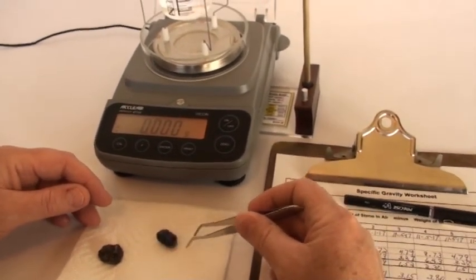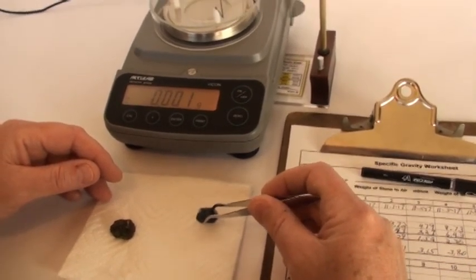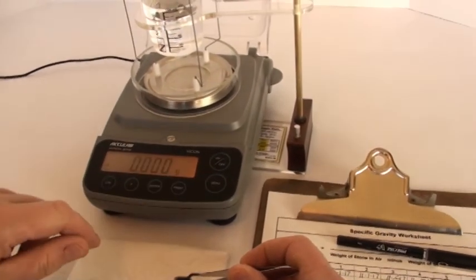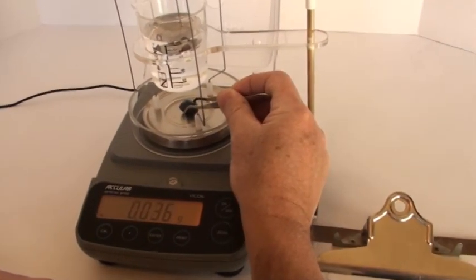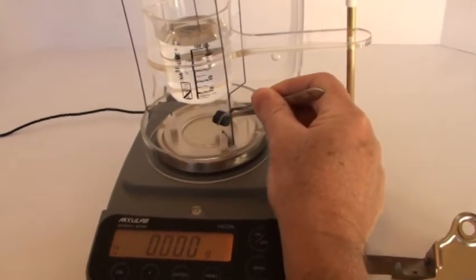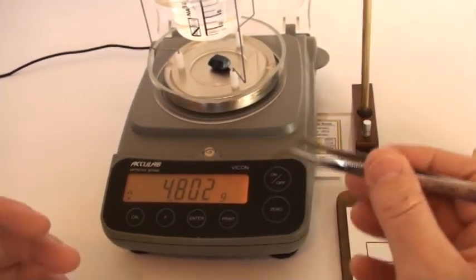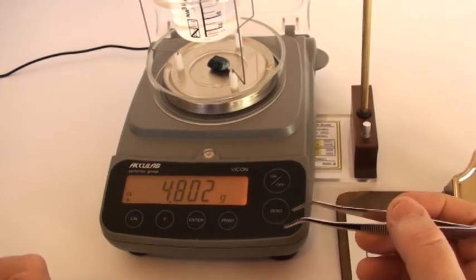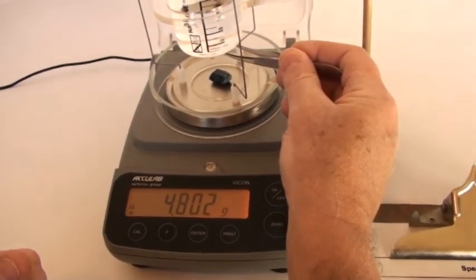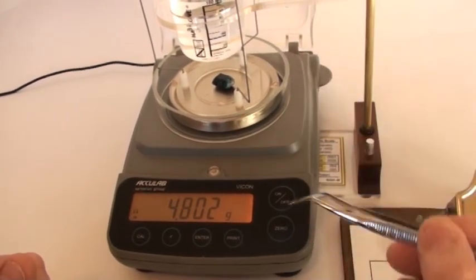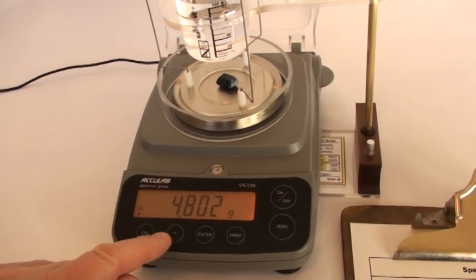Here's a blue mineral we're going to weigh. Starting with weight in air. Again, make sure your scale is zeroed out. And then just place it on the weighing platform of the scale. And the weight in air is, there's nothing mysterious about it, it's simply the same as weighing your stone on the platform itself. Notice how there's plenty of clearance below the beaker here to fit your stone. And we record our weight: 4.80.